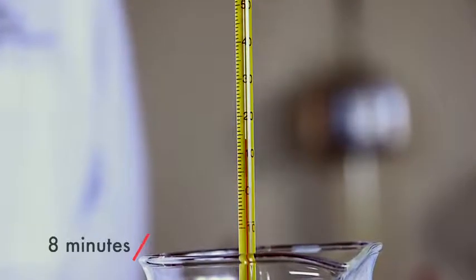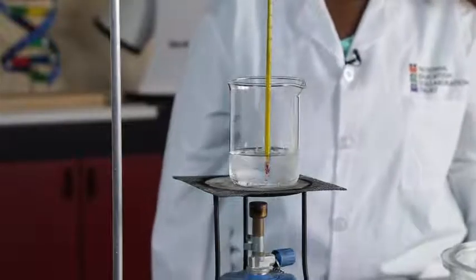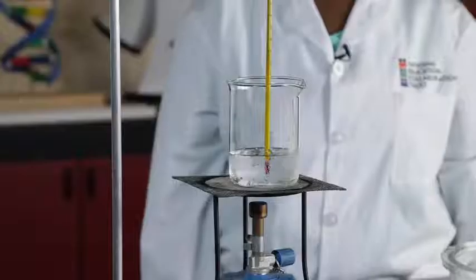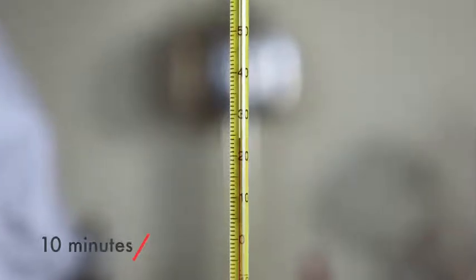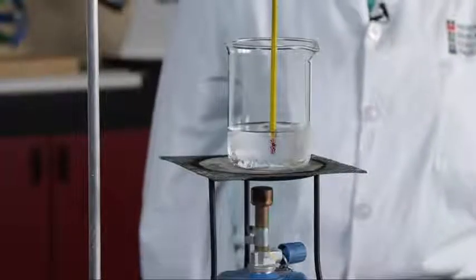This is the thermometer reading at 8 minutes. Write it down yourself. This is what the beaker looked like at 8 minutes. This is the thermometer reading at 9 minutes. Write it down yourself. This is what the beaker looked like at 9 minutes. This is the thermometer reading at 10 minutes. Write it down yourself. This is what the beaker looked like at 10 minutes. This is a thermometer reading at 11 minutes. Write it down yourself. This is what the beaker looked like at 11 minutes.